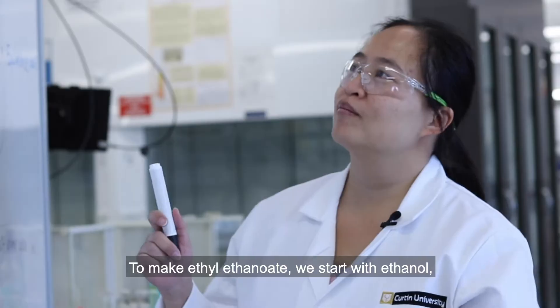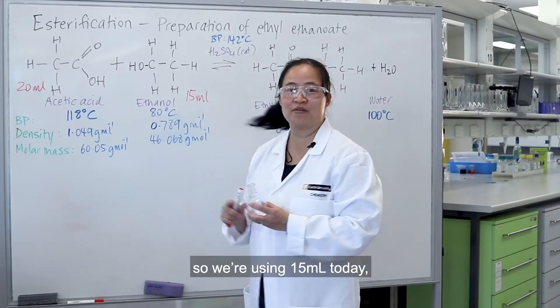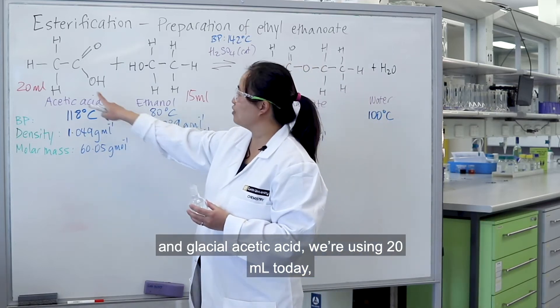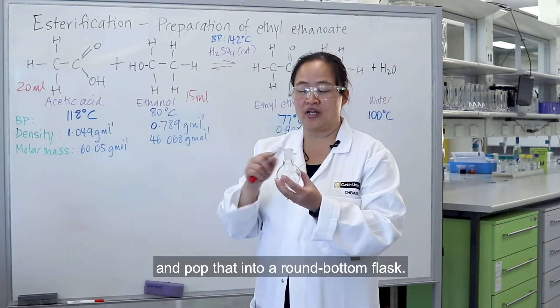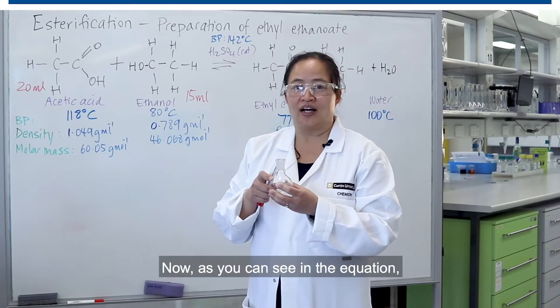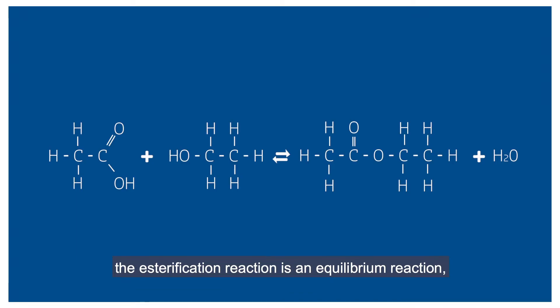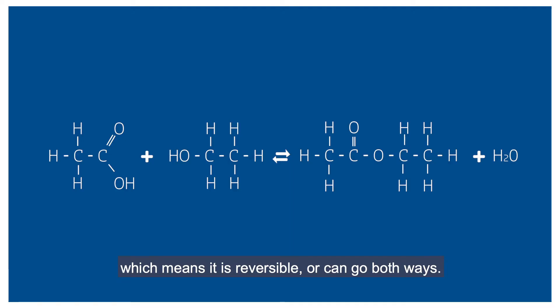To make ethyl ethanoate we start with ethanol — we're using 15 ml today — and glacial acetic acid — we're using 20 ml today — and pop that into a round bottom flask. As you can see in the equation, the esterification reaction is an equilibrium reaction which means it's reversible, or can go both ways.